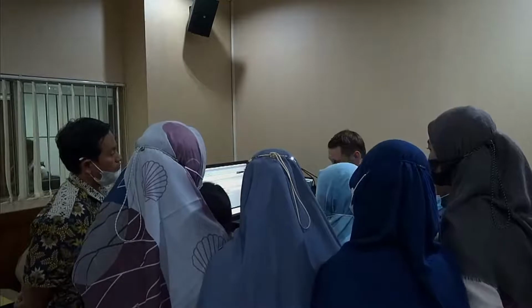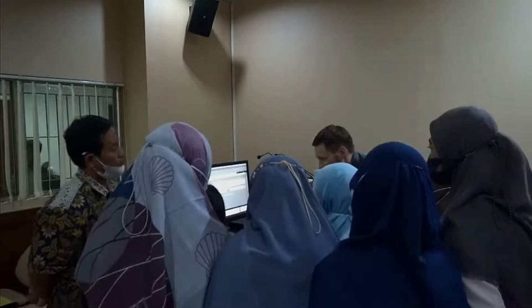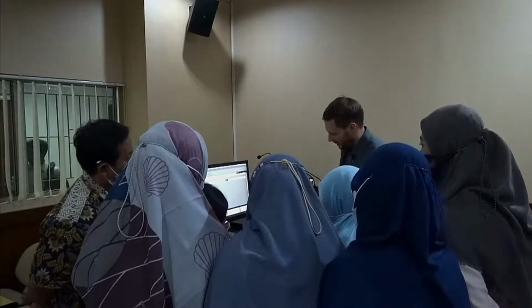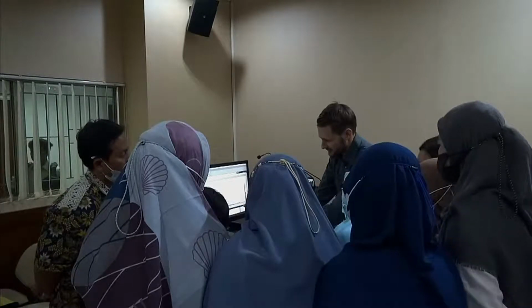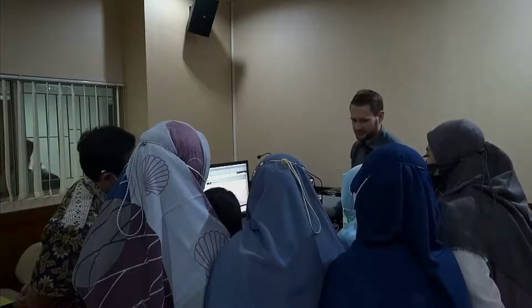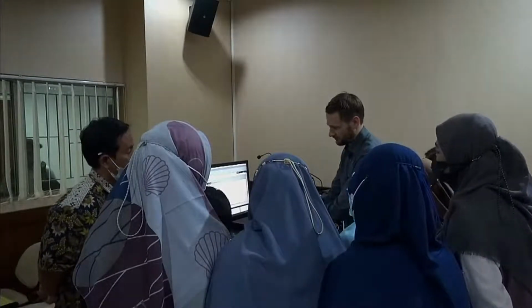Now we can enter a name for a measurement, like, for example, F500. That's the name of the material. We click OK. First thing that happens now, we will adjust the detector element. You will see here the live signals, and it's putting the detector in a position where the original laser beam is the highest. So the best position for the detector is always done before every measurement.